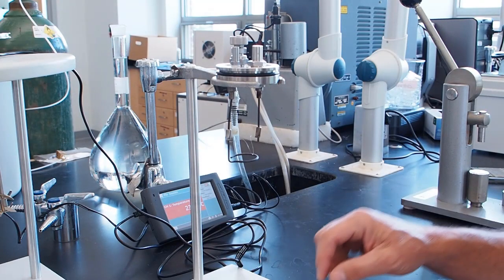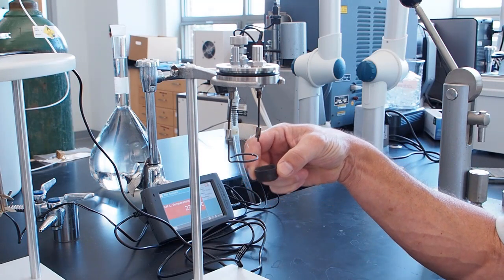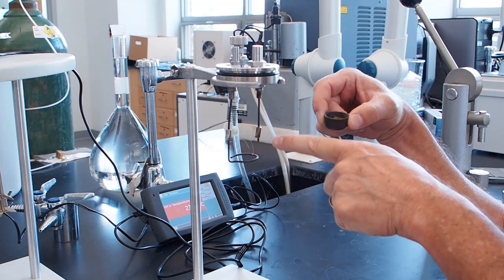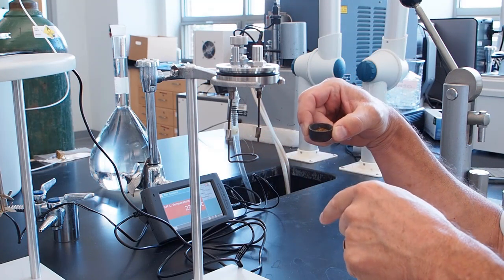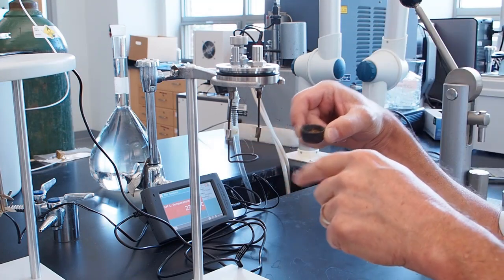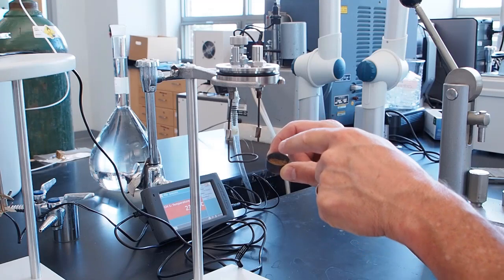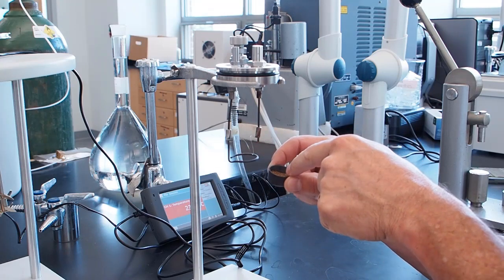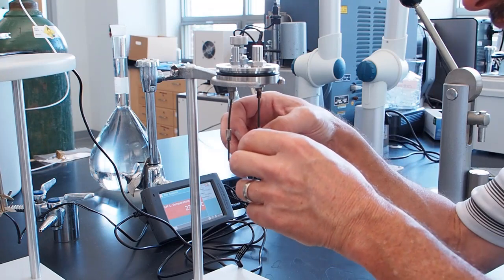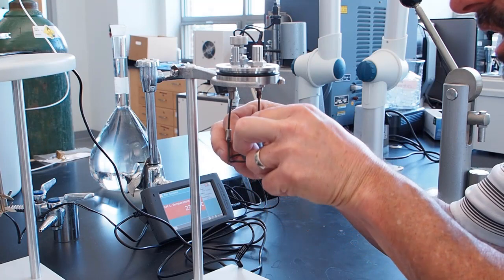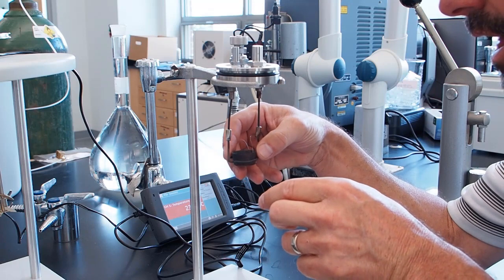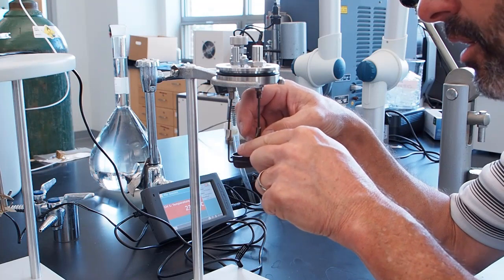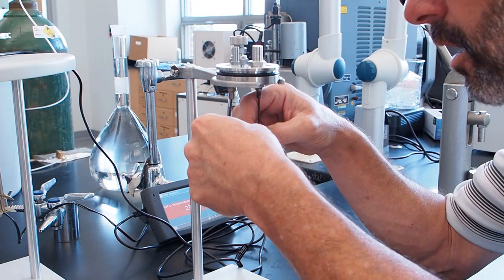Okay, so it's time to put the reactant into the part of the bomb calorimeter that's going to ignite it. And so this assembly here allows both oxygen to go in and also allows electricity to come in. So what we've done is we've attached this small ignition wire, which we've weighed, to the two electrical leads. And the idea is that's going to sit on top of the dog food, touching the dog food, and that will burn and ignite the dog food. So the reaction cup has to be below this, the wire has to be in contact with the dog food, but the wire can't hit any other metal. So we're going to very gently lift this up, put the cup underneath it, and there it sits. And now the wire needs to not touch the cup, it needs to touch just the dog food, because that's what we want the burning to happen. So we're going to push this down on it.